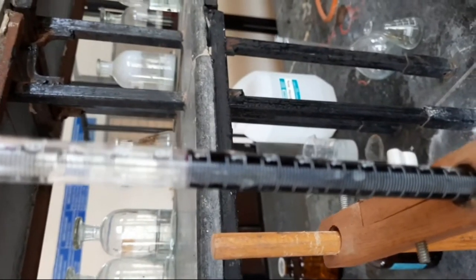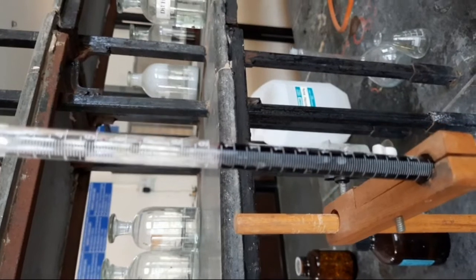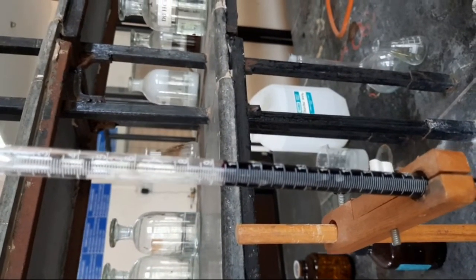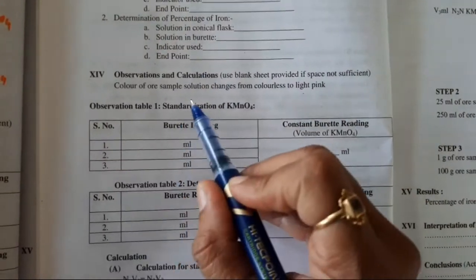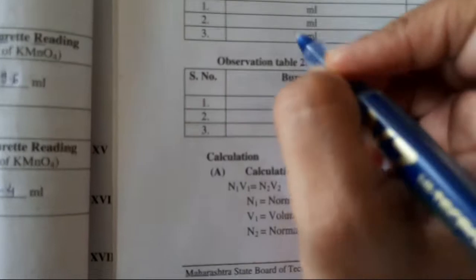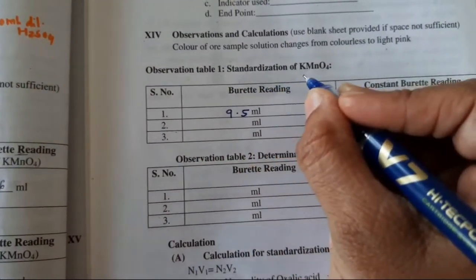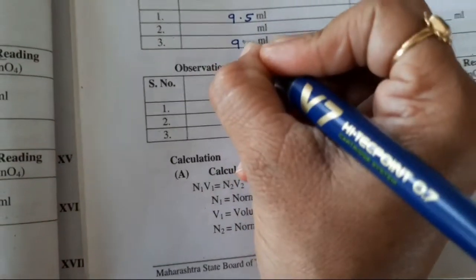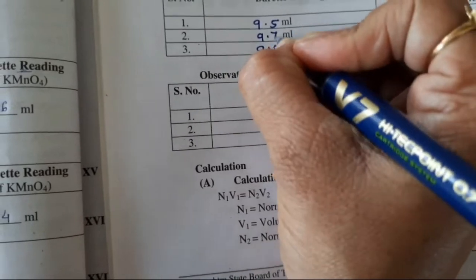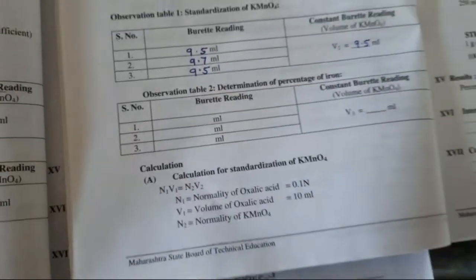Check the burette reading — it is 9.5 mL. Write this reading in observation table number one, which is the standardization of KMnO₄. Take two more readings; they will appear in the range of 9 to 10. Out of three readings, take the two that are constant as V2. So V2 = 9.5 mL.